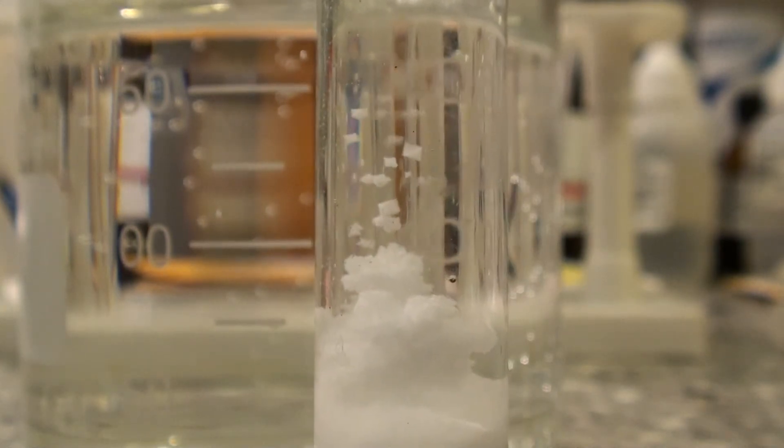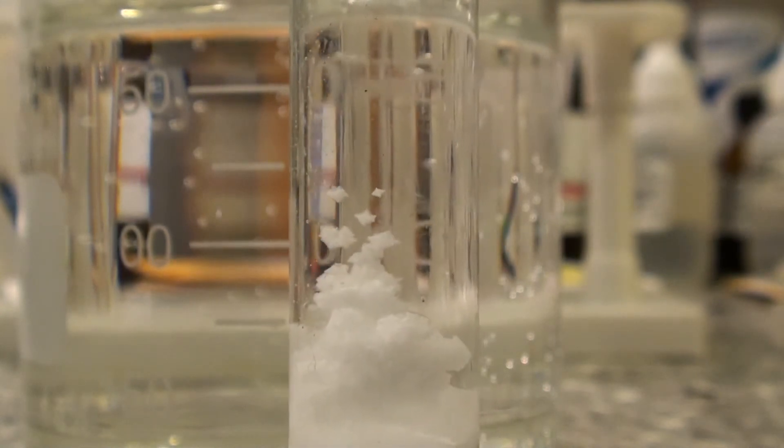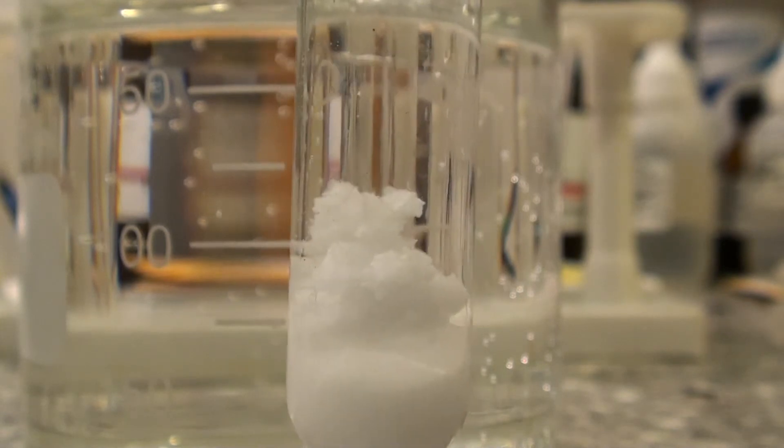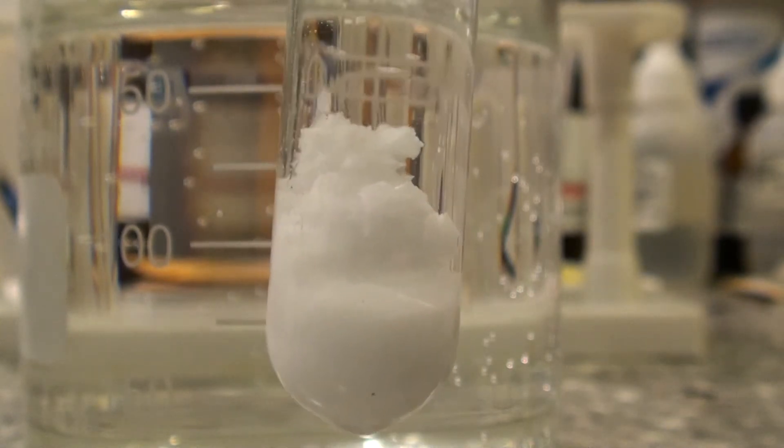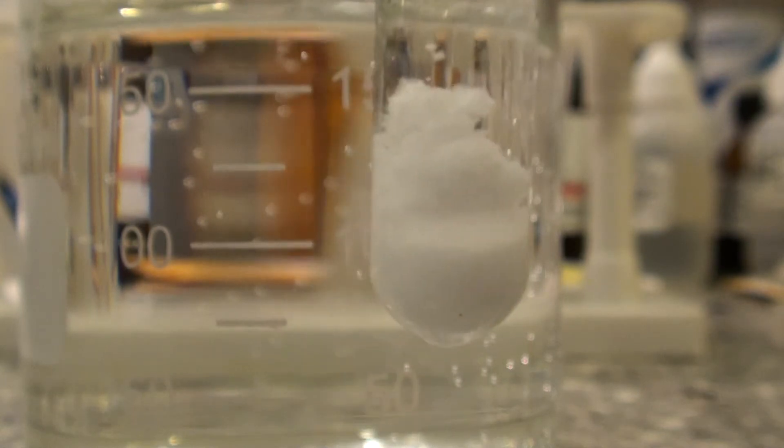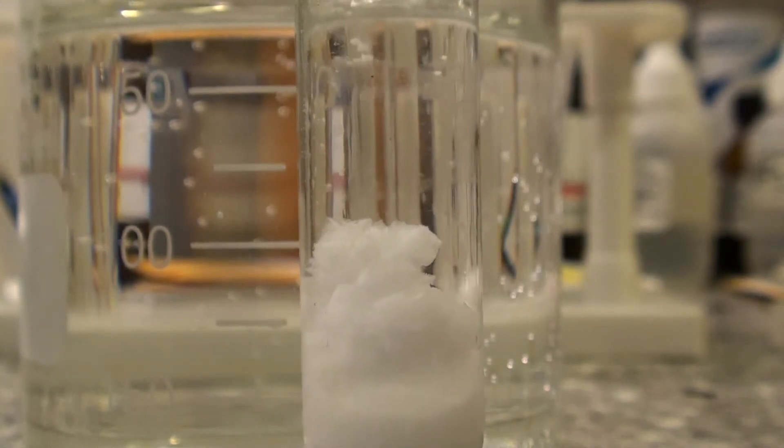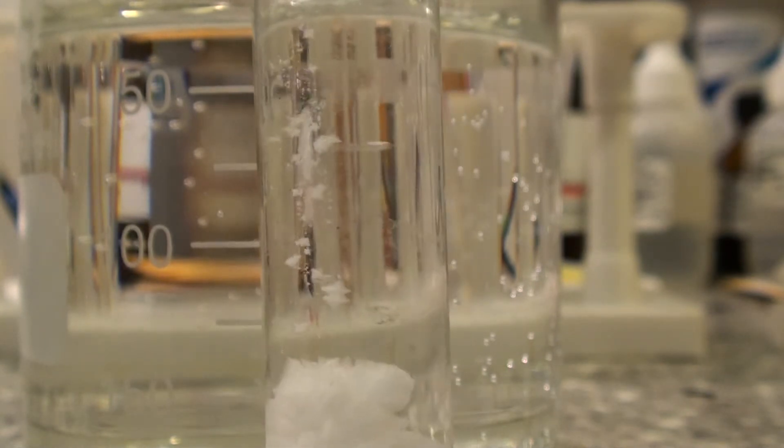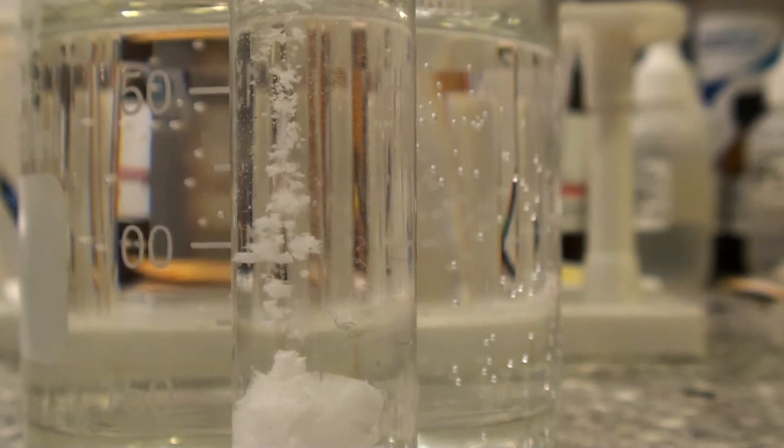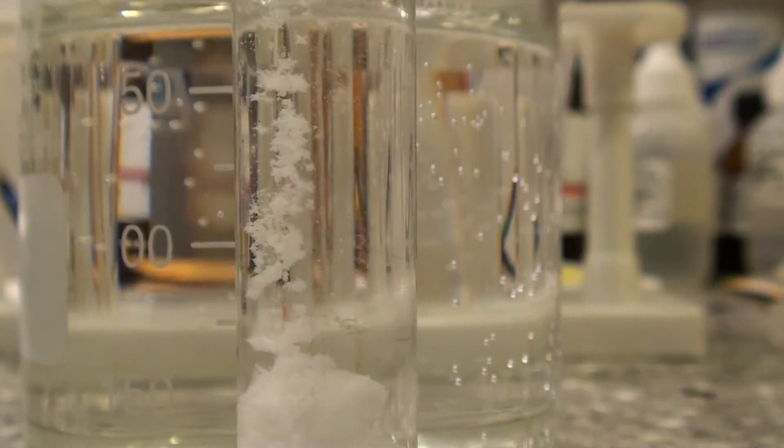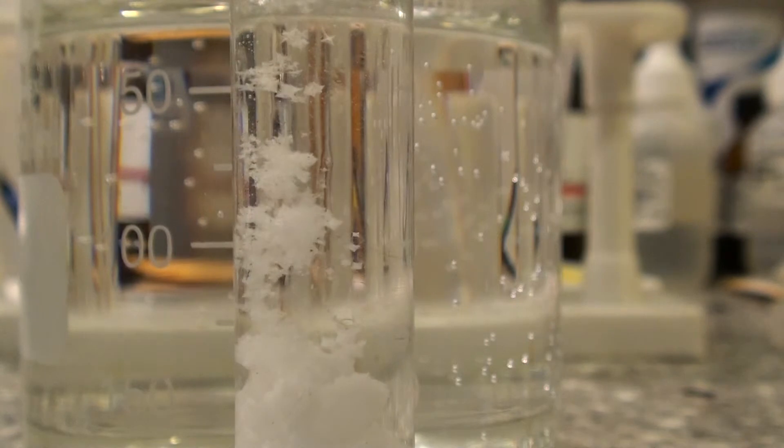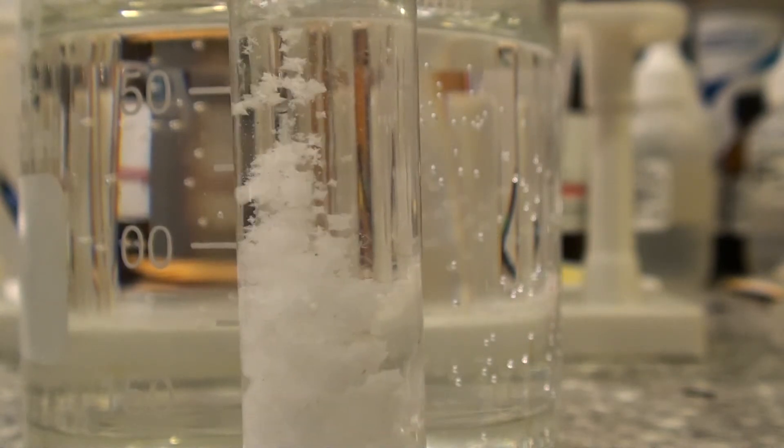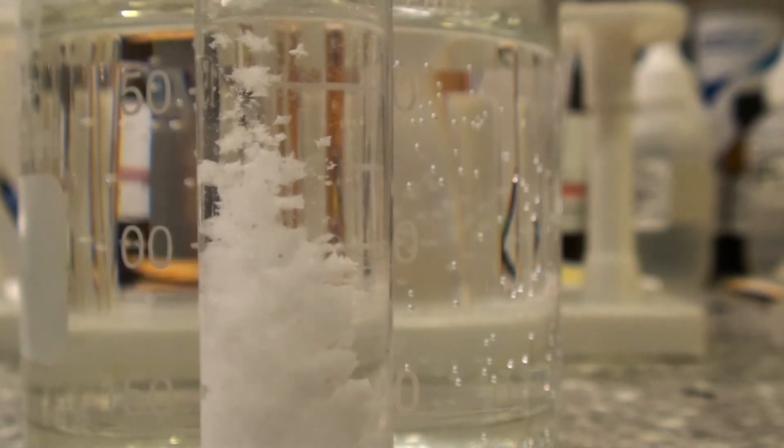It looks kind of, I call it chemical snow. For the strange chemical up here. It's a chemical that's kind of like snowing to the bottom of this water. There we go.